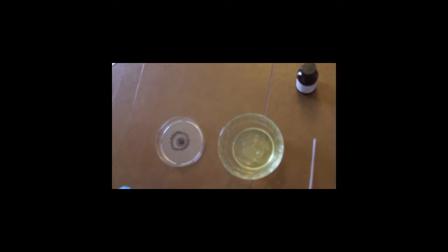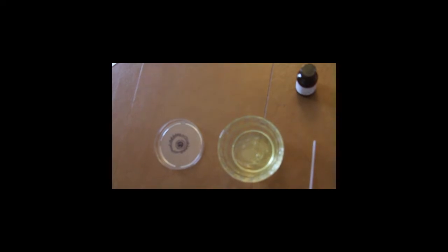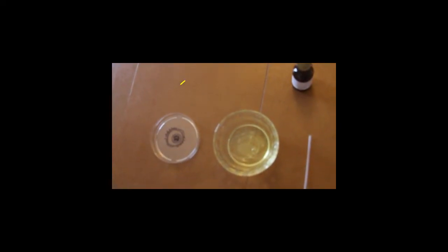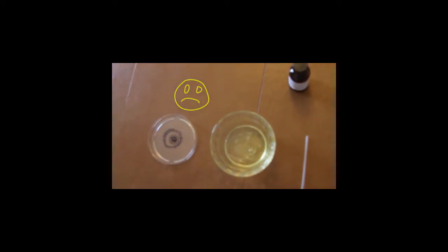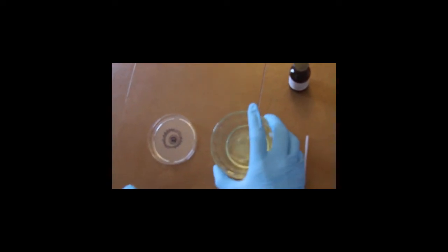When these concentrated amounts of acid react with the proteins here in the egg whites, the denaturing is almost instantaneous and irreversible, and this simulates the damage that would be done to the eye if sulfuric acid was to interfere with the eyes and the retinas. So I'll go ahead and demonstrate for you what we're doing here. So this is our egg whites, and I'm simply just going to pour them into the petri dish.